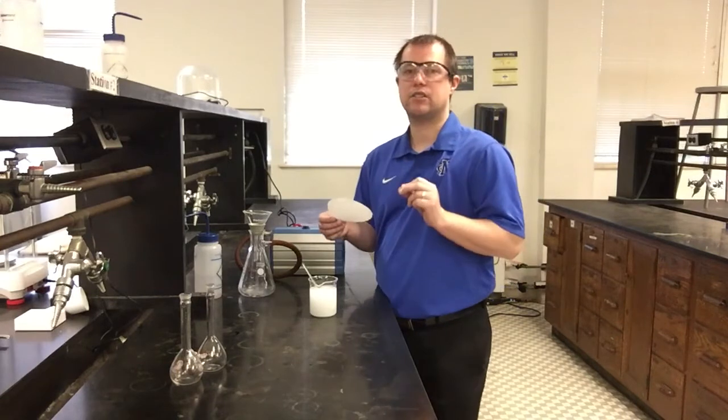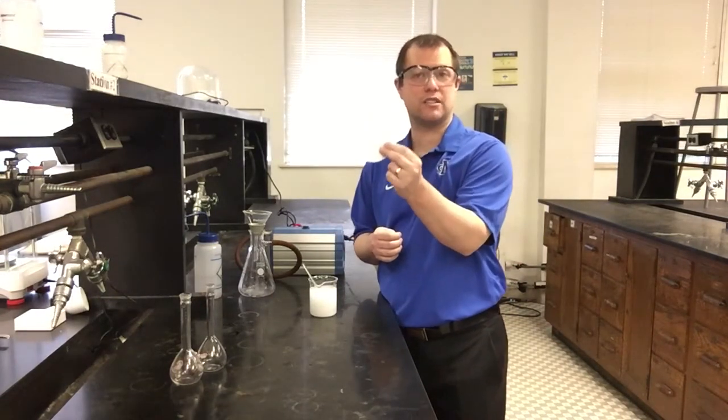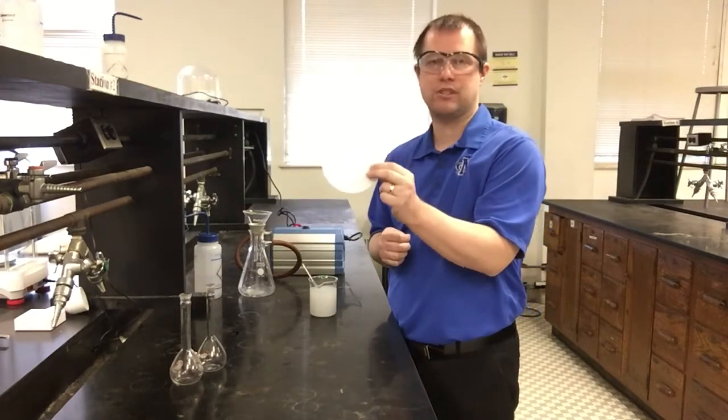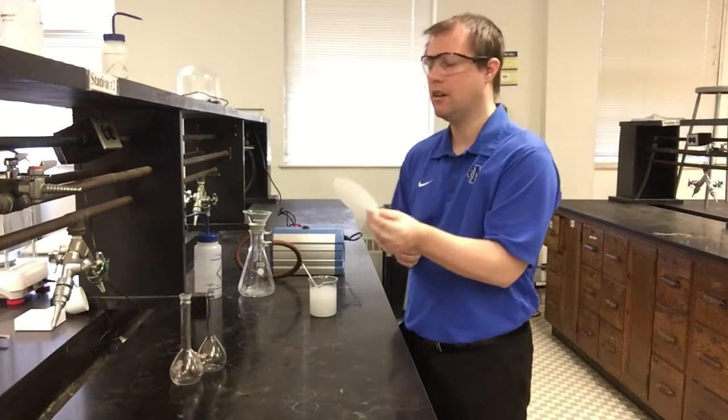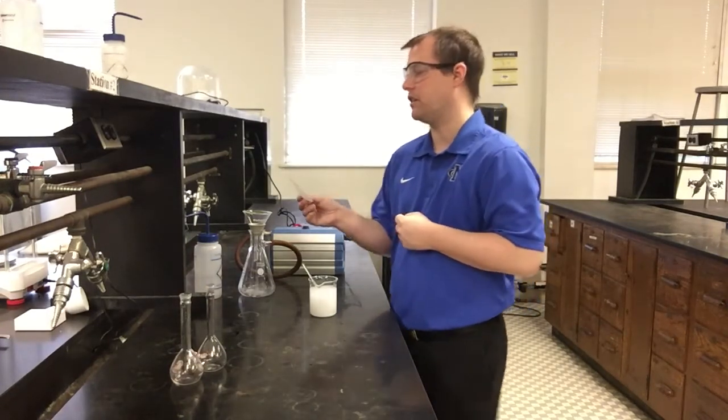And so how that's going to work, setup's going to be very similar. I still have a piece of filter paper. I've pre-massed this, so I do know this thing's mass. That is going to be important to be able to figure out how much product I'm going to make. This thing's mass is 0.928 grams. You can write that down, or I'll show all the data on a piece of paper here at the end as well again.